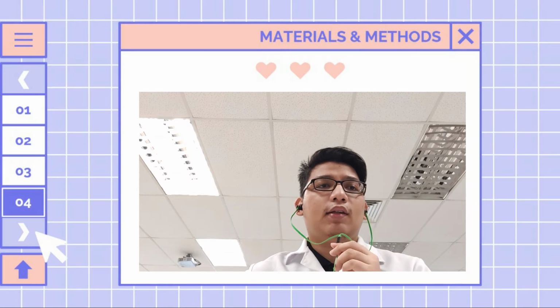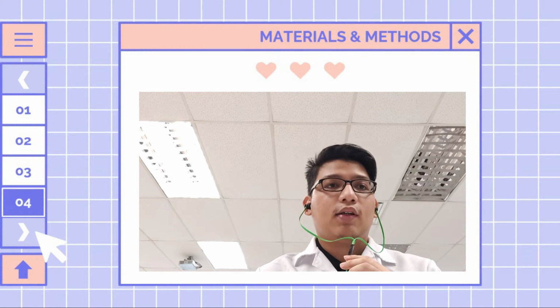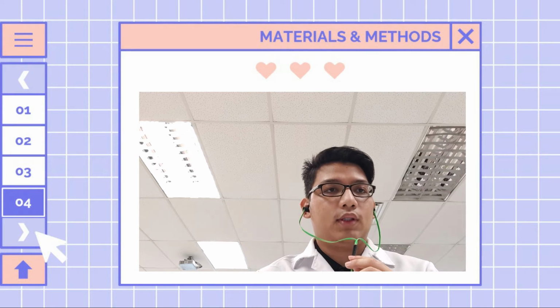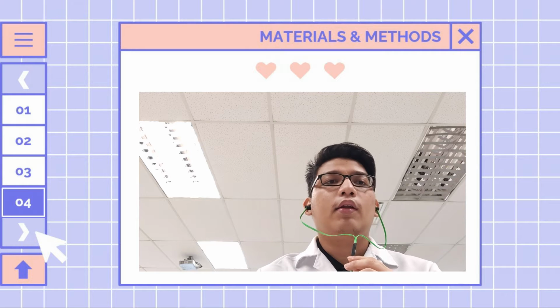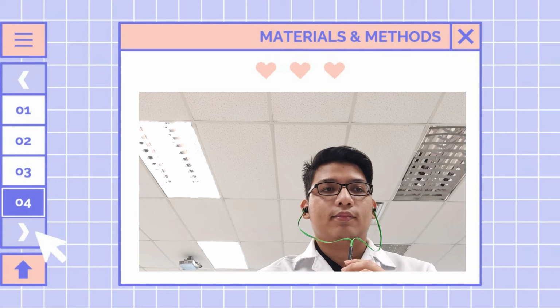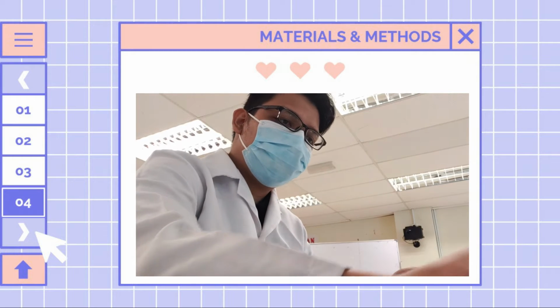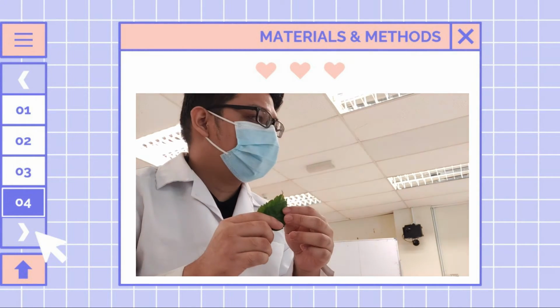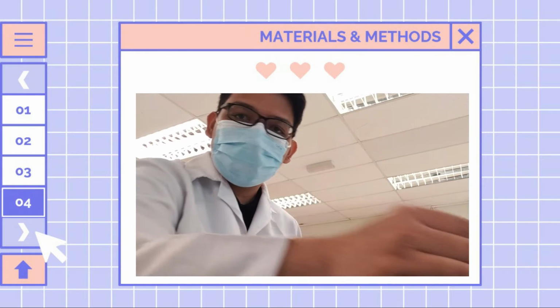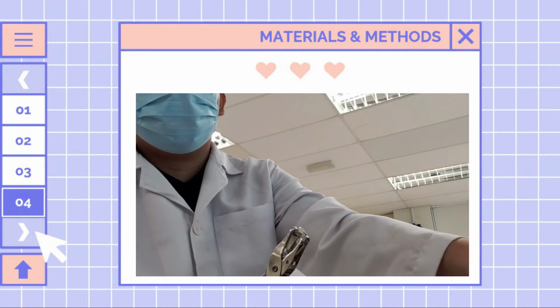The materials that are needed in the experiment are leaves, syringe, carbon dioxide, baking soda, distilled water, beaker, hole puncher, and a ruler. Let's dive deep into the steps of the experiment. First, we have to choose one species of plant. Then we have to find the common name or the scientific name of the plant. Use a hole puncher or straw to get 10 leaves of the plant.